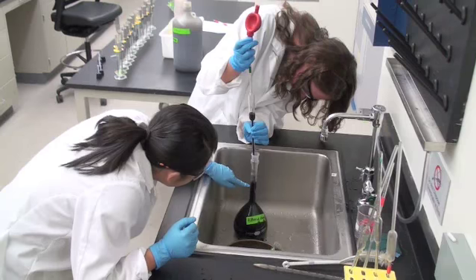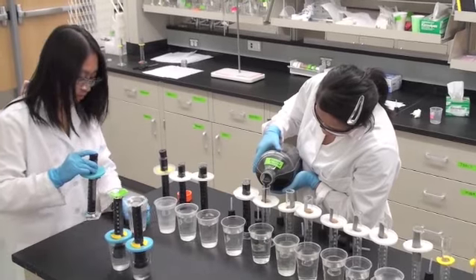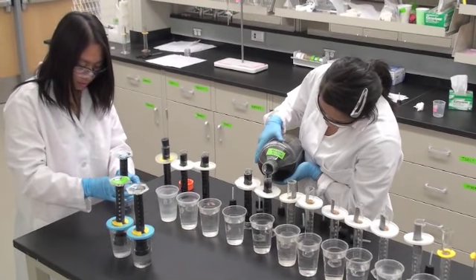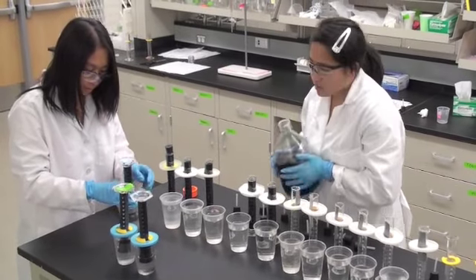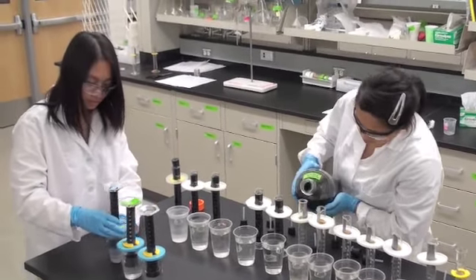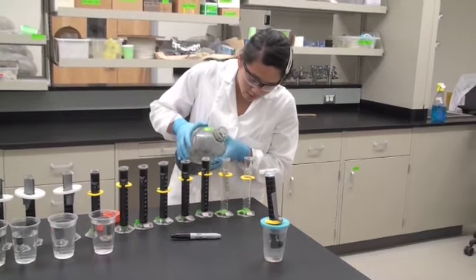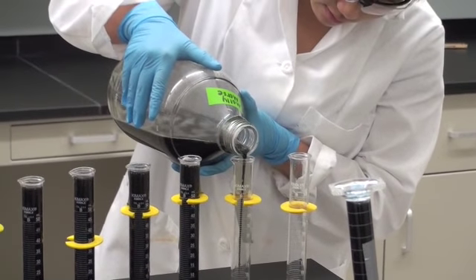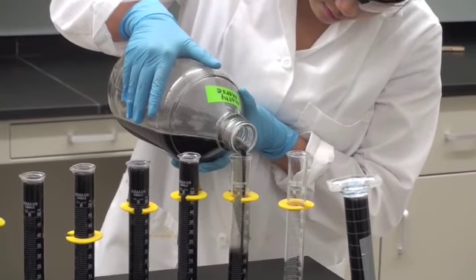In our case, we use 1 part anaerobic digester solids, and 1 part warm tap water. The desired amount of biomass is quickly poured into the graduated cylinders. The microorganisms present in the anaerobic biosolids are ideally exposed to minimal oxygen during this experimental setup, so it is best to work carefully and swiftly to avoid potential oxygen influences.